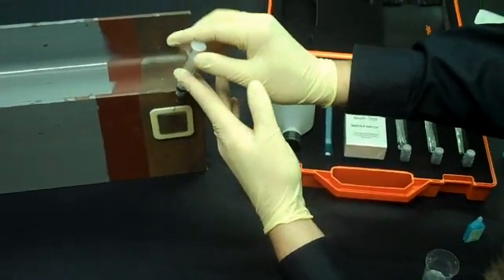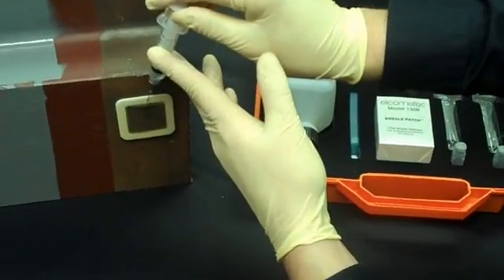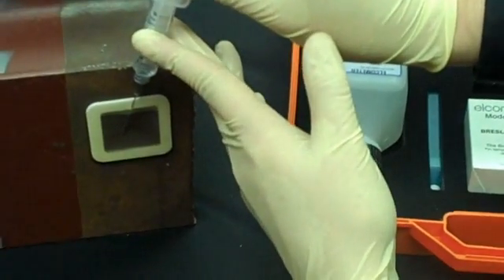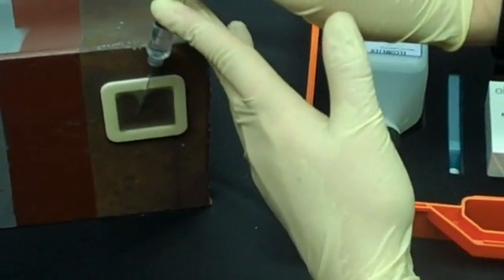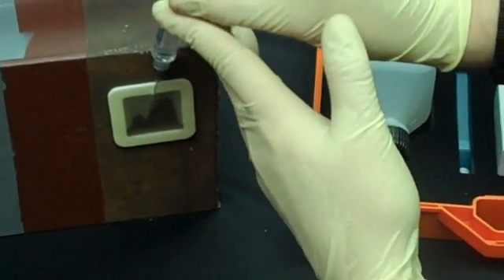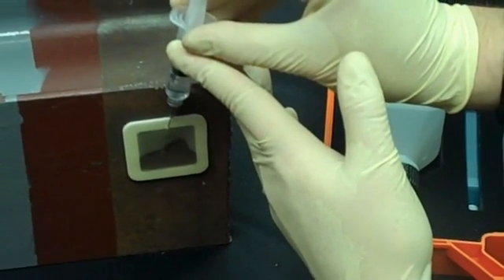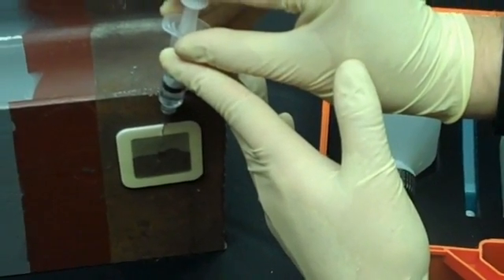You want to pull the solution out back into the syringe, and then you want to put it back in once.